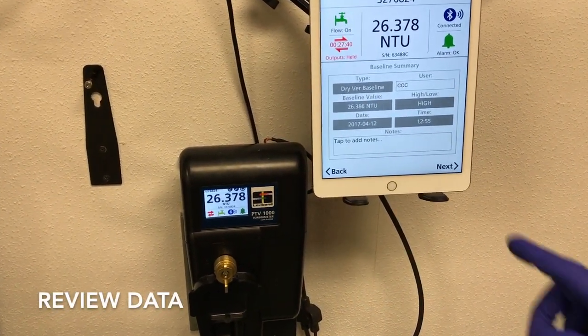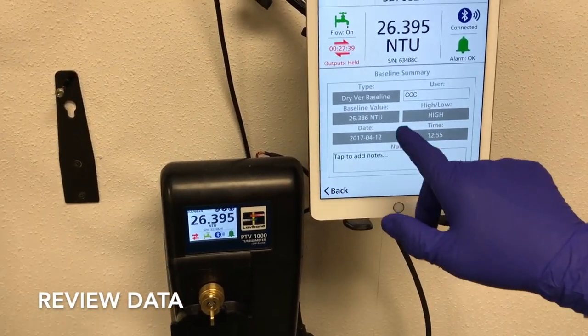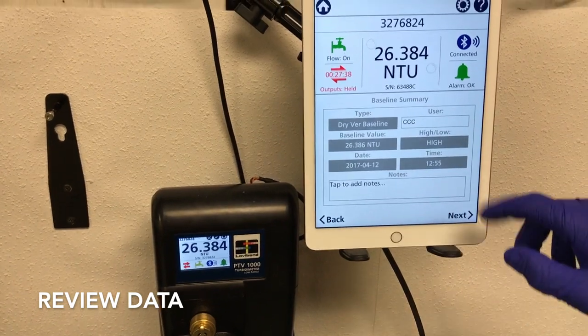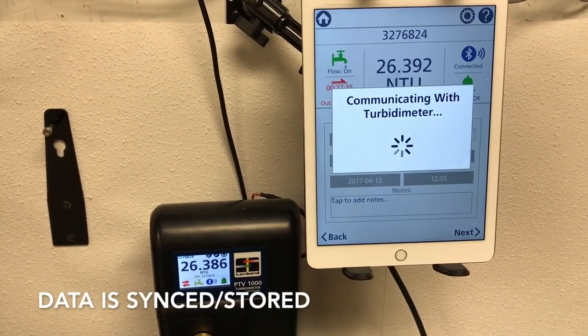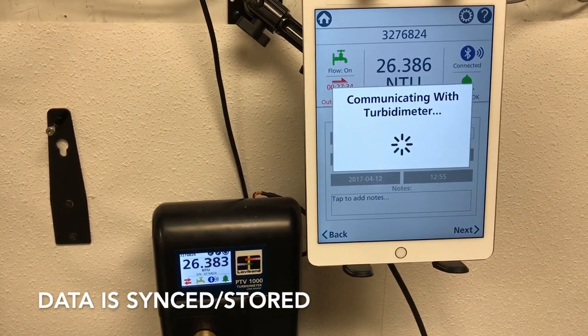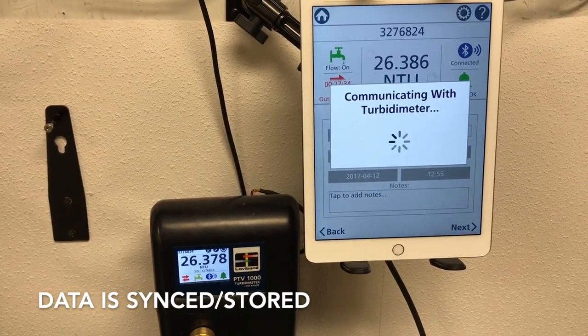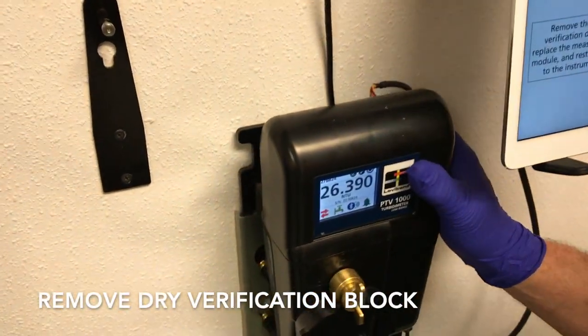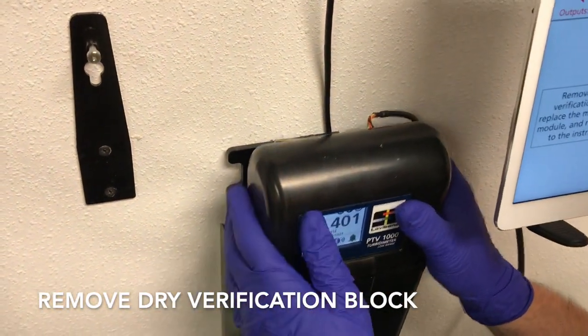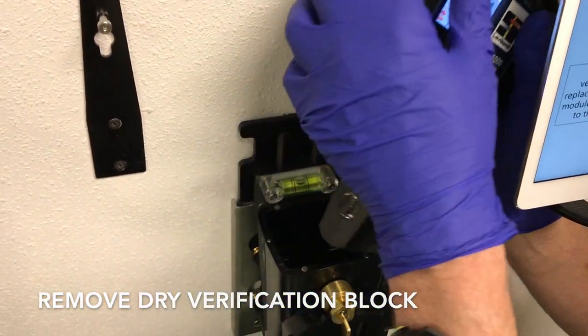Values accepted will show in a baseline summary. This data is now synced and stored on the device. Removal of the dry verification block is next.